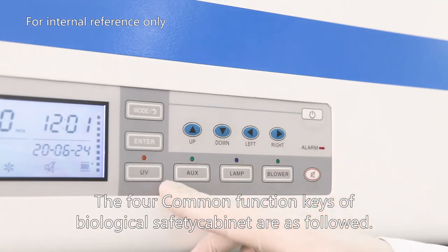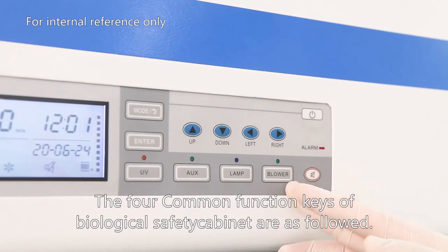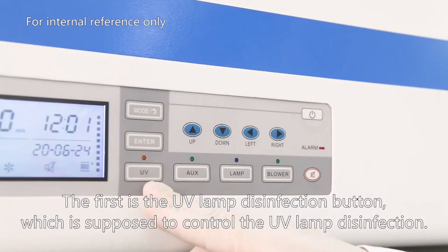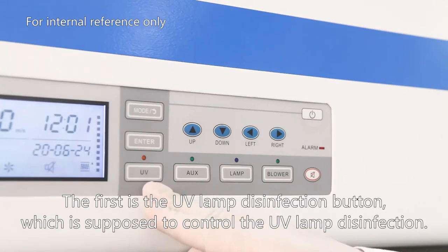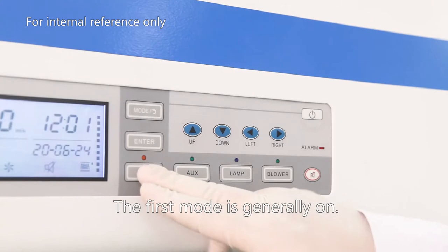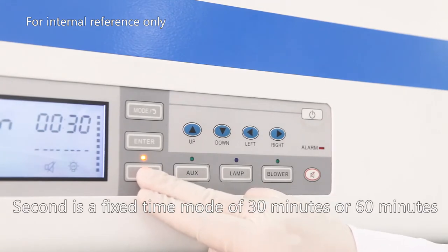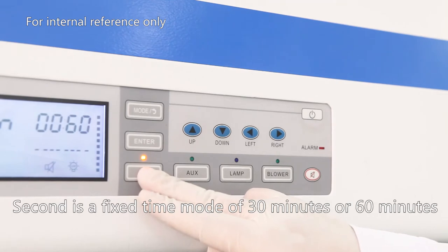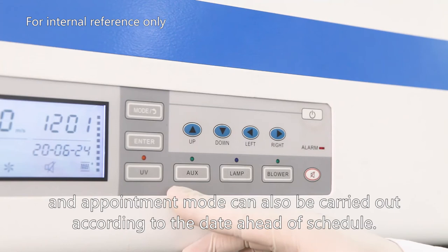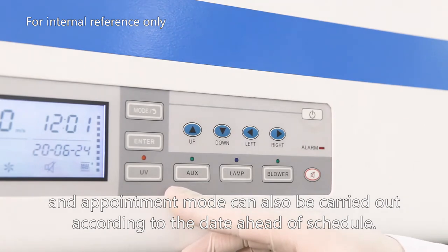The four common function keys of the biosafety cabinet are as follows. The first is the UV lamp disinfection button, which controls UV lamp disinfection. The first mode is generally on. The second is a fixed time mode of 30 minutes or 60 minutes. An appointment mode can also be carried out according to the date ahead of schedule.